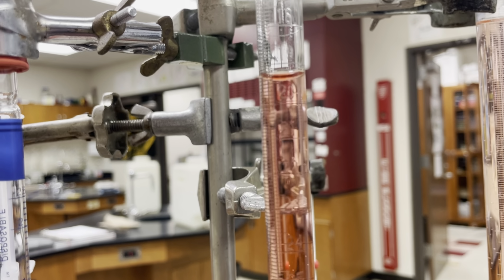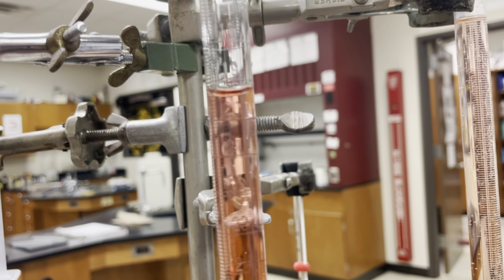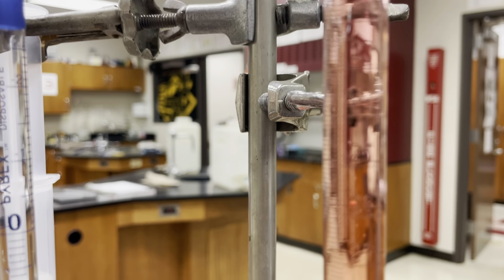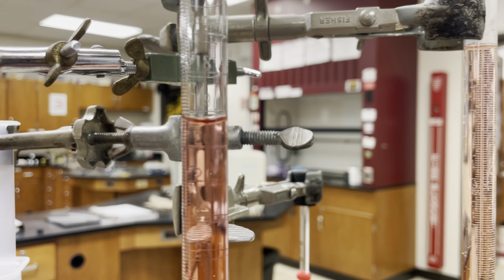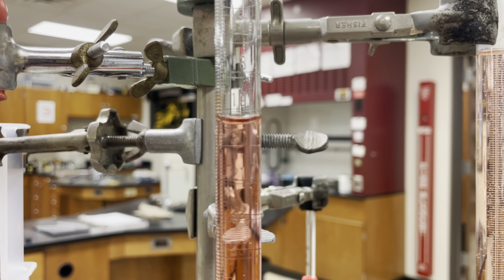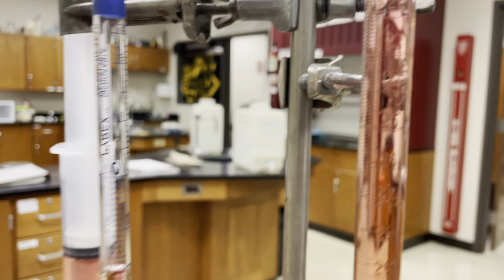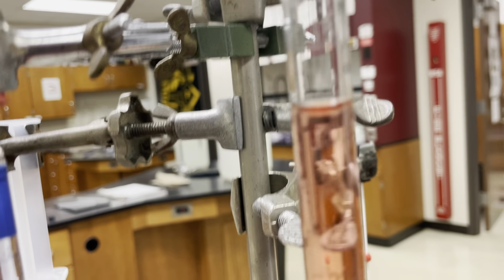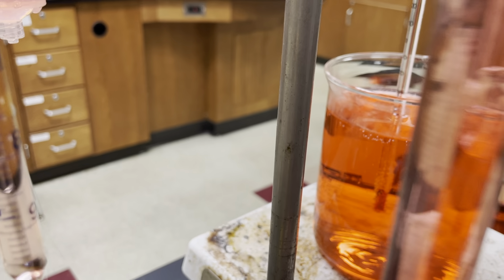I'm actually going downward, so it should be 19 point something. So this is going to be about 19 point, maybe 19.3. I want to move the camera so I can see it with my own eyes a little bit, so ignore the fact that I'm pointing the camera at nowhere for a second.